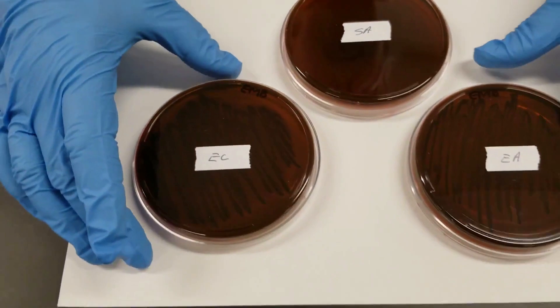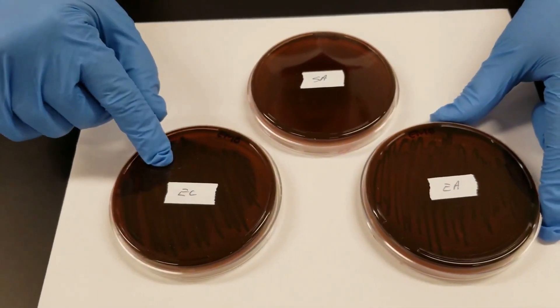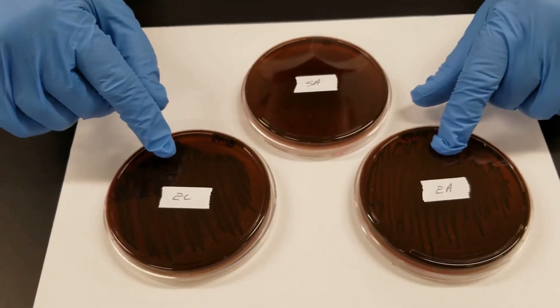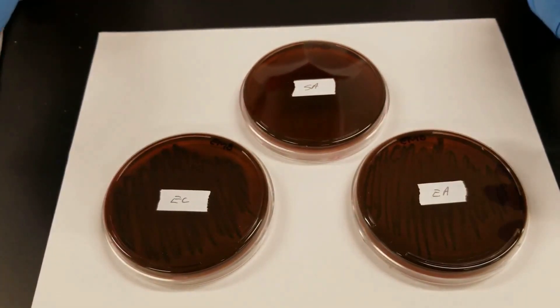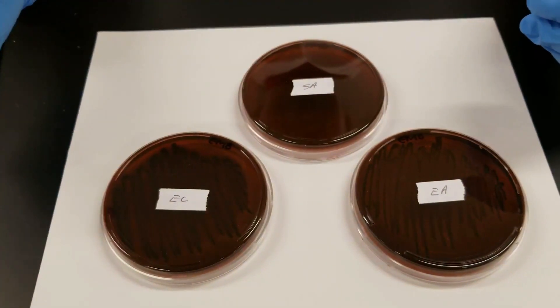For the two gram negatives — E. coli over here and Enterobacter aerogenes on this side — we did get growth. They're both gram negatives, so that makes sense.